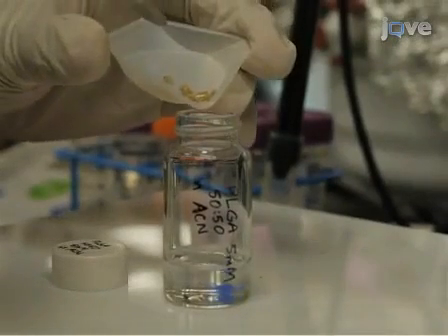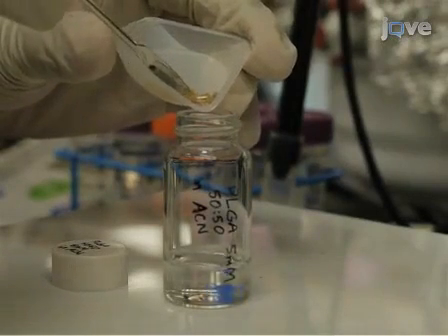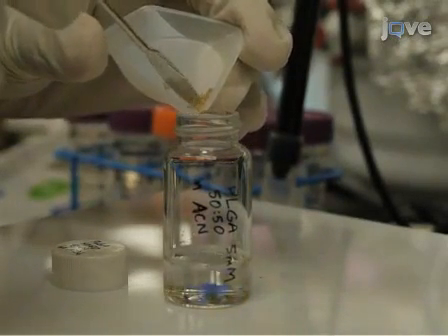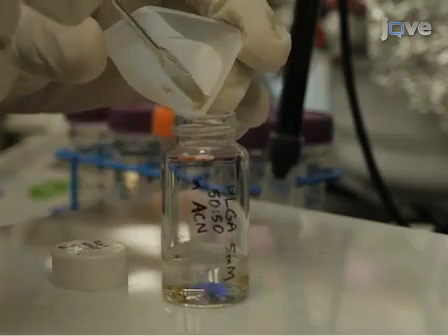To begin synthesis of the PLGA PEG copolymer, dissolve PLGA carboxylate in acetonitrile at a concentration of 5 millimolar with gentle stirring.